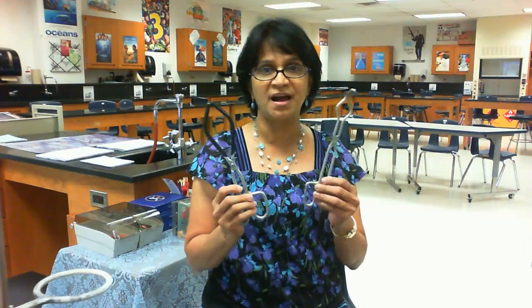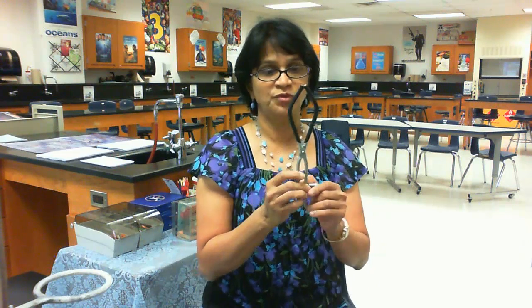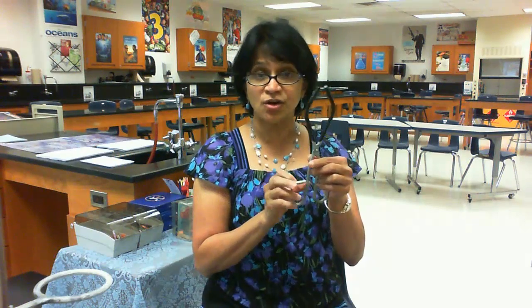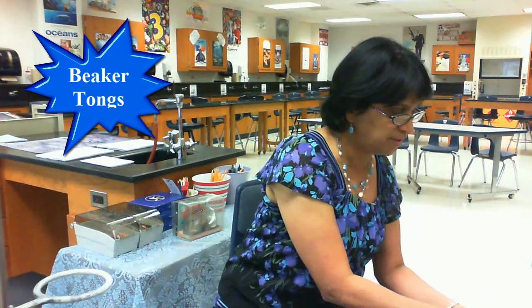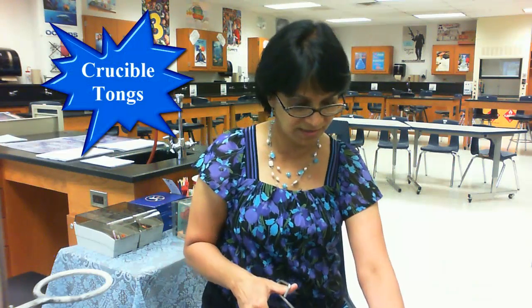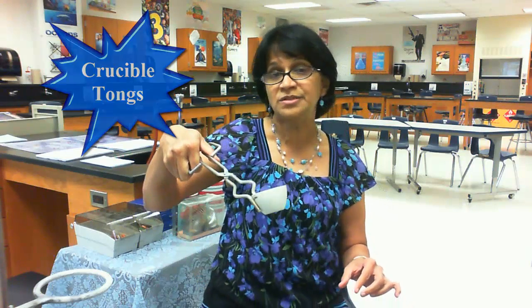We have these two things that might look alike but are different. One of them, having wider tongs, is called beaker tongs — it can be used for lifting a beaker, say if the beaker is hot. The other ones are crucible tongs, and they can be used for lifting a crucible.